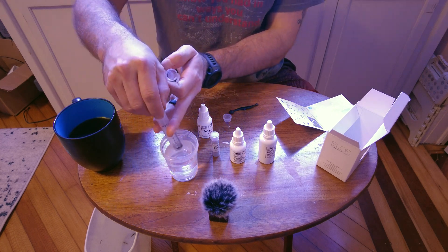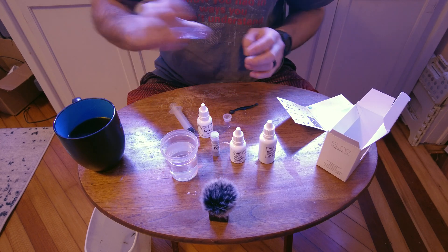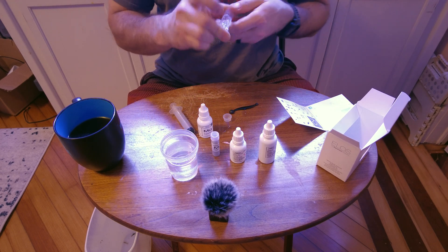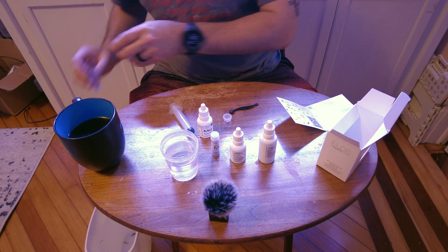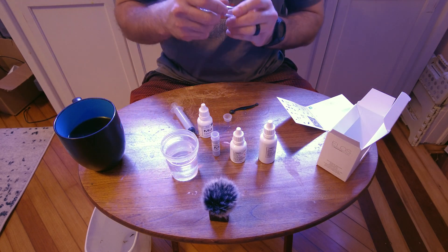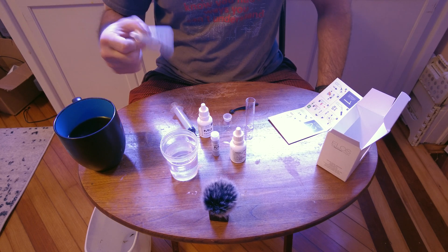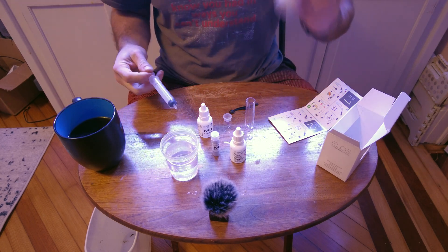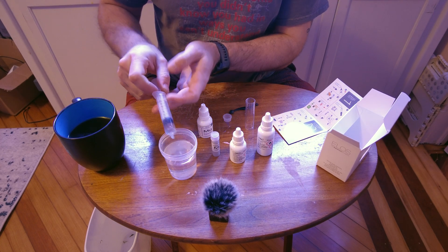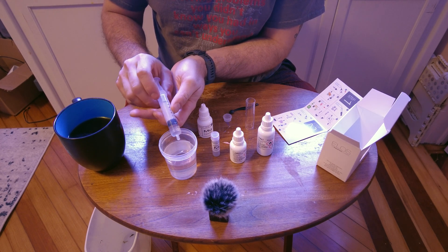First I'm going to rinse the syringe — draw a full 10 ml to make sure any residue from previous tests or manufacturing is removed. I've got a waste bucket next to me on the floor. We've got our nice clean vial now. I almost skipped a step — I still need the three milliliters, so we're going to draw up our three right to the meniscus.